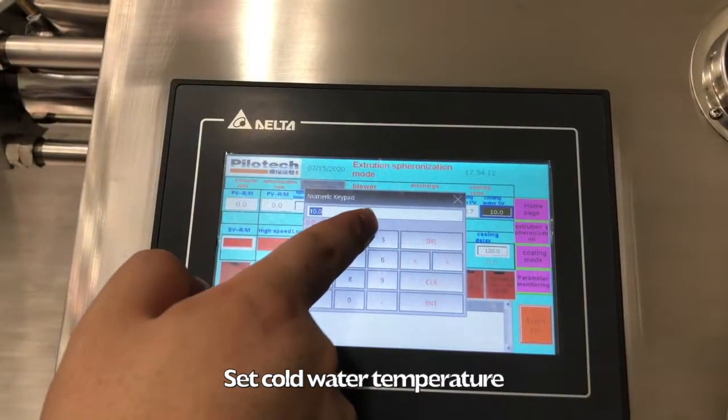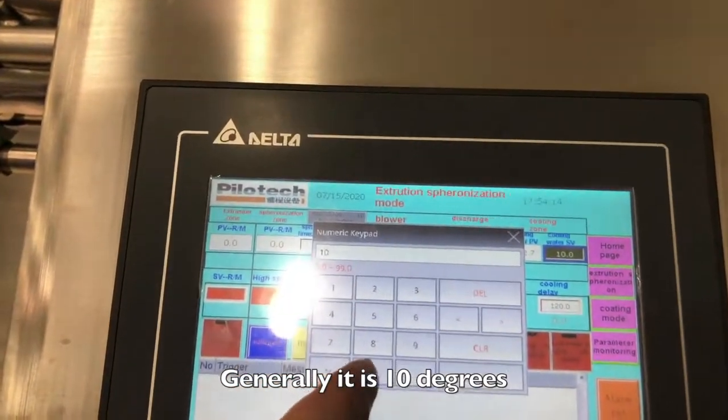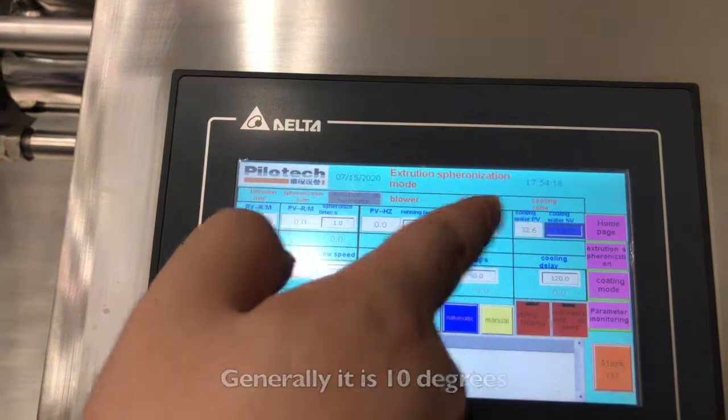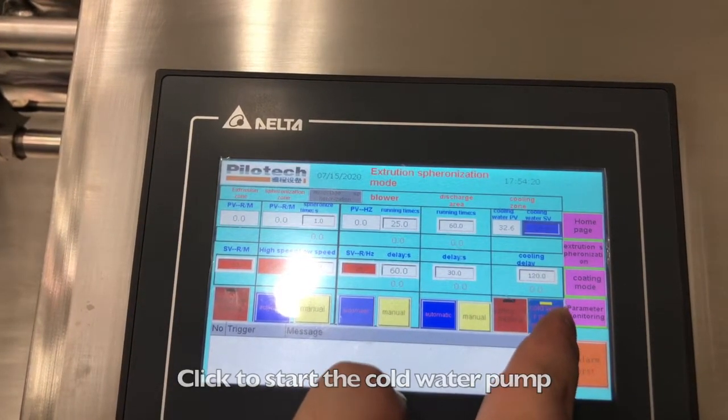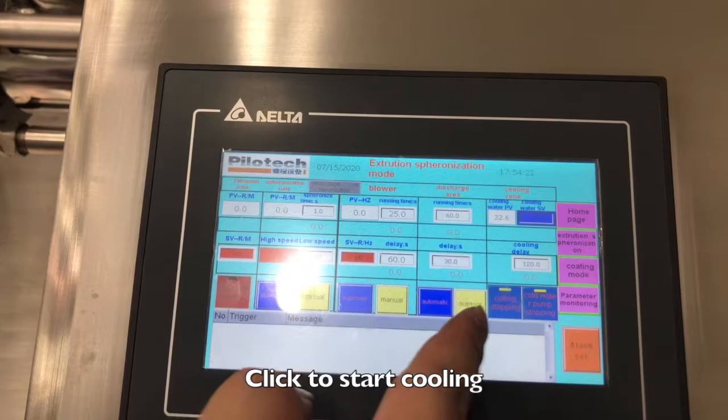Set cold water temperature, generally it is 10 degrees. Click to start the cold water pump. Click to start cooling.